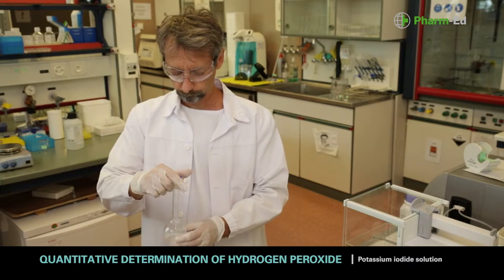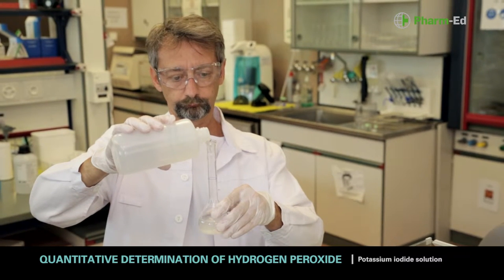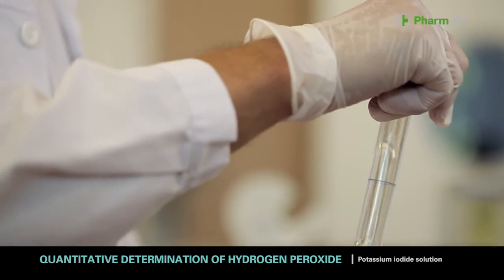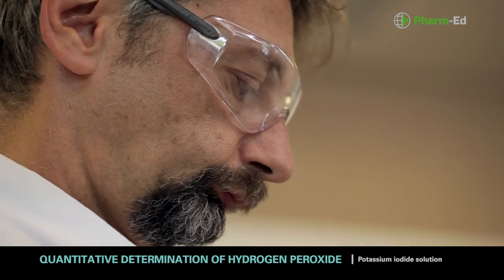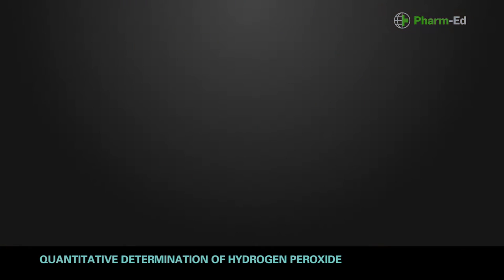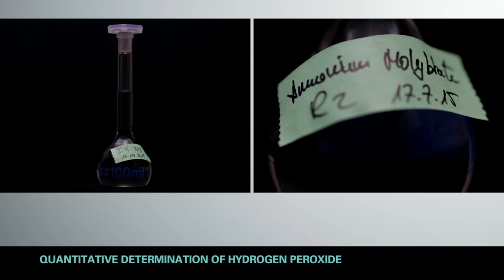Close the flask and shake to dissolve the powder properly. Then add distilled water to make it up to the 100ml mark. Label the flask with the name of the solution and the preparation date. The two reagent preparations can be stored for up to a month.